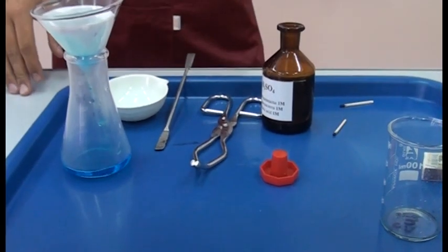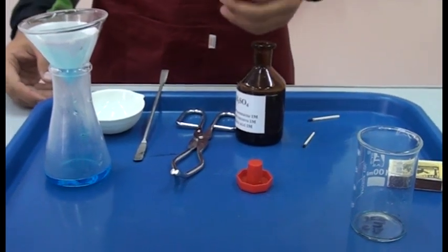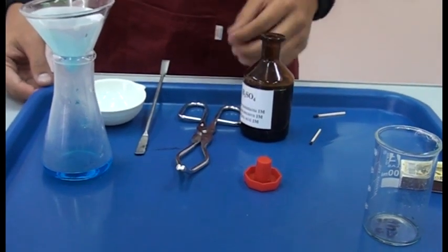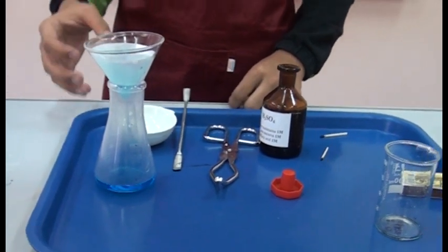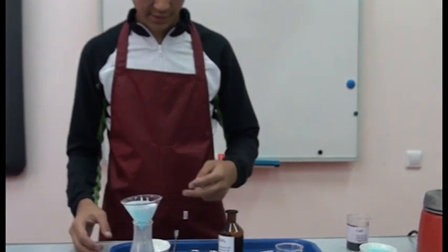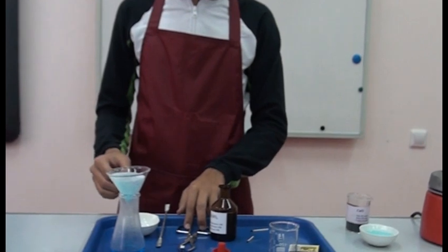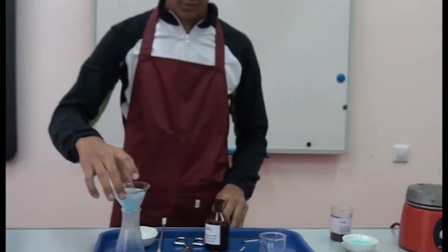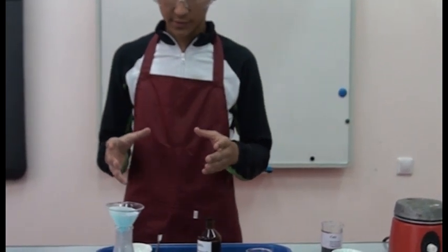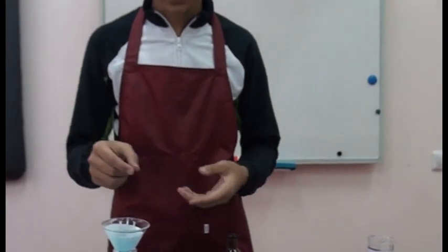Then when we have the copper sulfate, the second action is that we must make them crystals, like blue crystals of copper sulfate with a mixture of water. The second product is water. The important moment is that we must divide it from water, because the copper sulfate crystals will become white. We need some water inside.